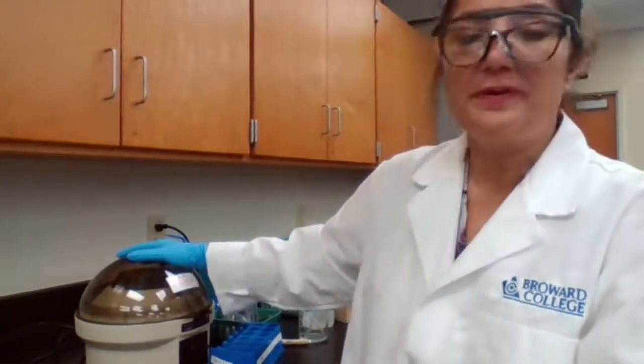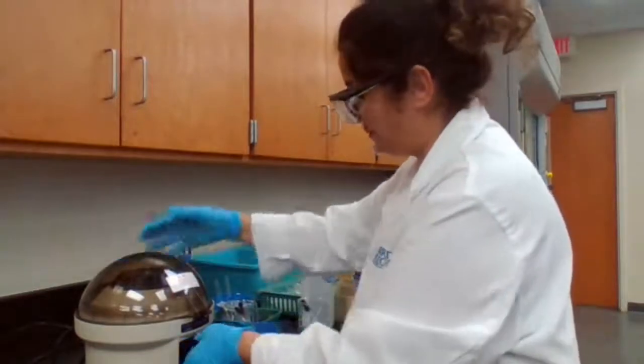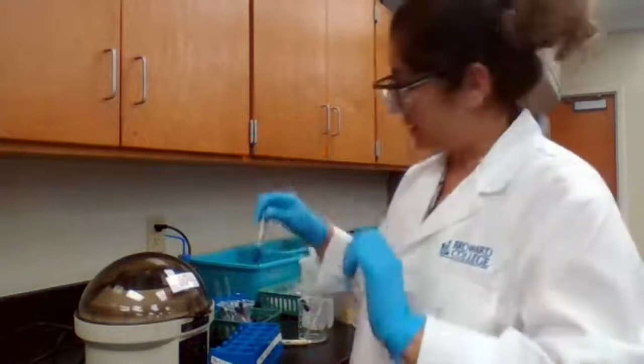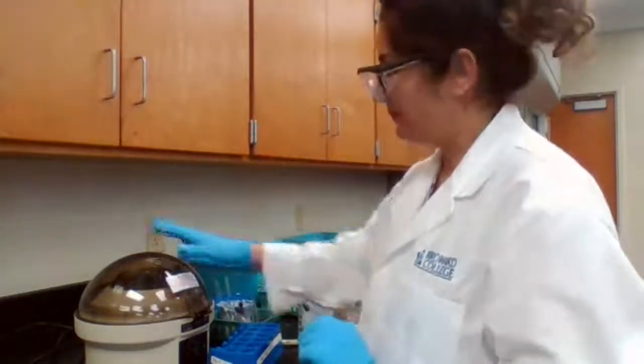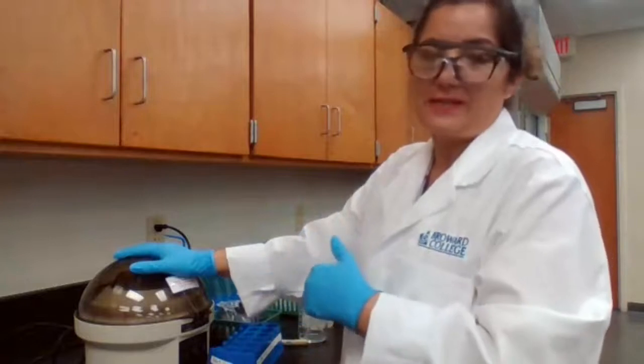When we're working in a group of 2, I usually ask the students not to waste time because the lab partner could work on the copper, but since it's only me, I have to finish with one before I can move to the next one.